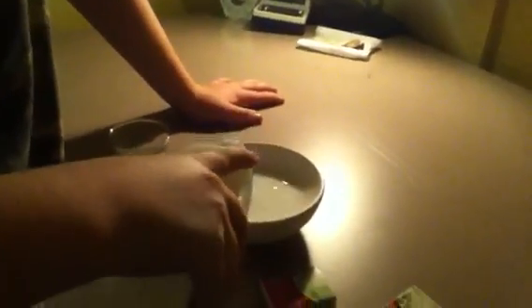She got some on me — it kind of burns. Then put some in that dish. Now I need a knife, so I'll go over to my old lab set up and get a knife. Take the matchbox, quickly dip it in some acetone, and then scrape it off.